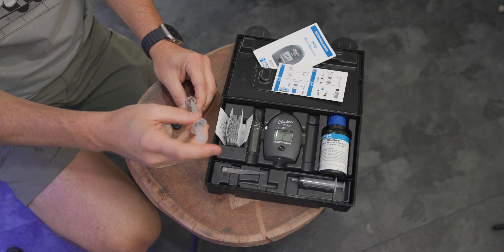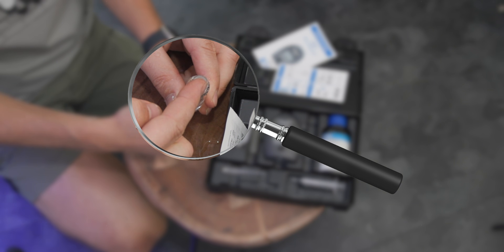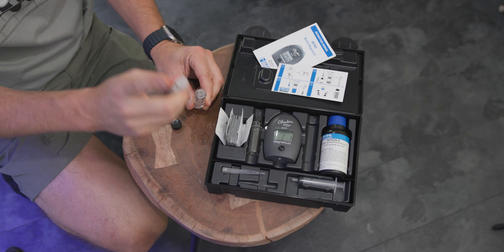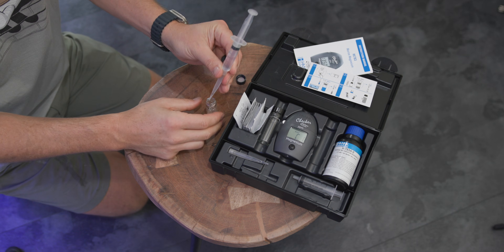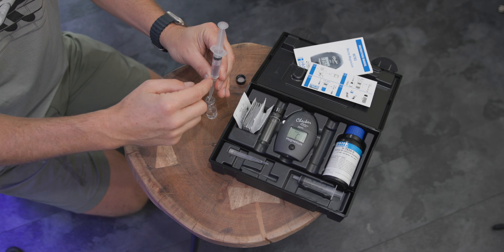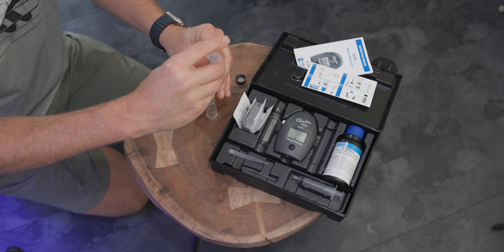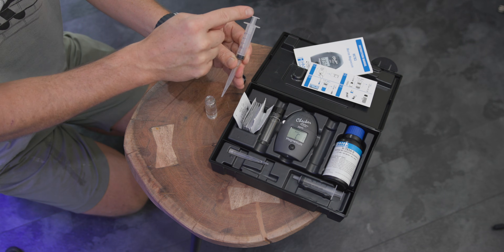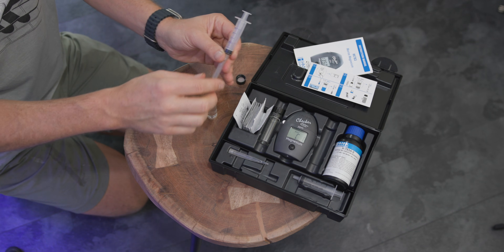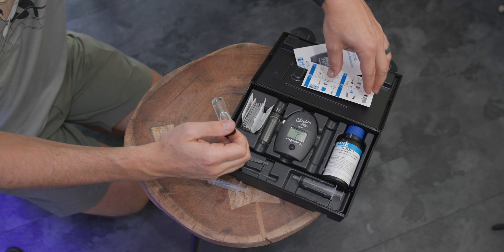I've got five mils of tank water. If you push too hard, you blow off the tip — like I just did. Go slow, don't push too hard. Here's my cuvette. Put the syringe right in the top, hold it, and use your other hand to gently but firmly press out all the liquid. If you have any liquid left in the tip, pull the plunger back and push it out with air. Now turn the cuvette over five times — don't shake it, just gently invert it so you don't create bubbles.